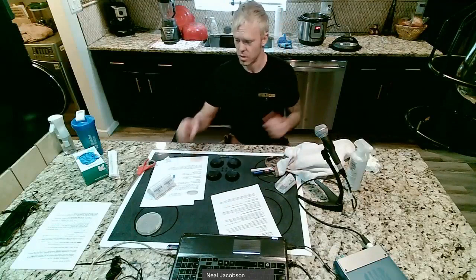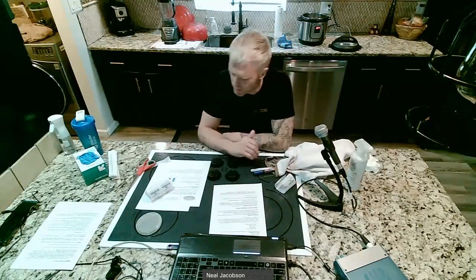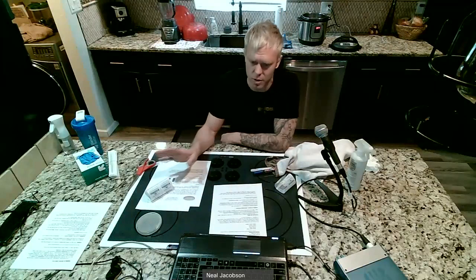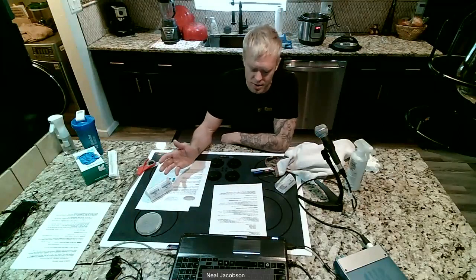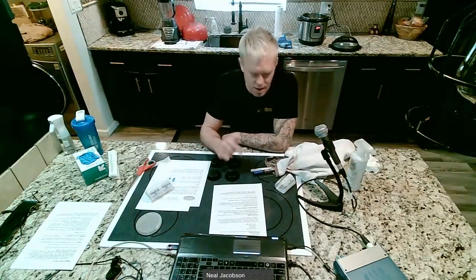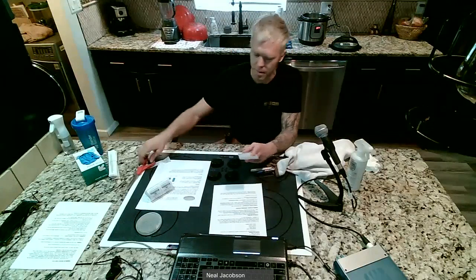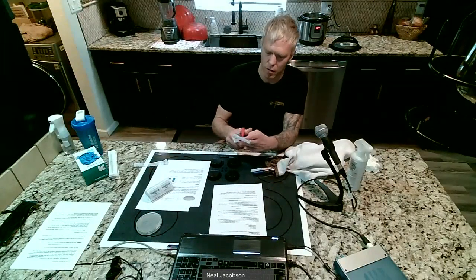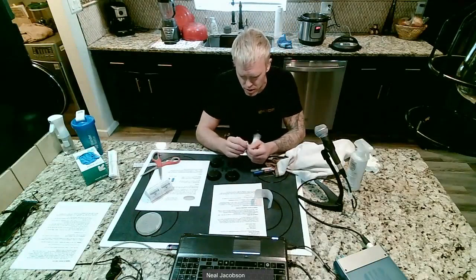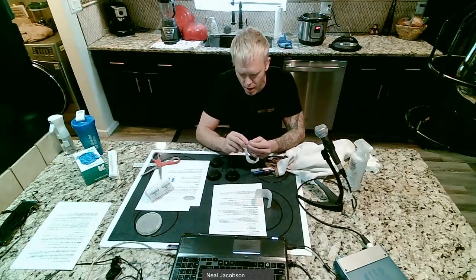Something we should do though, let's do this while we're sitting here. If we're doing an experiment, in this particular case, this hand washing one is definitely a comparative investigation because there's no control group. But what I think we should do is take our petri dishes, select one of them, cut a little strip of parafilm, and don't even open the petri dish. I want you to write on the bottom, control. And I want you to think about why we would be doing this.